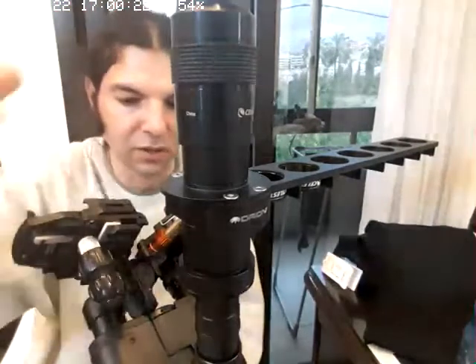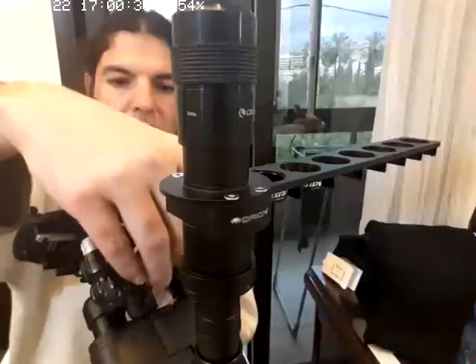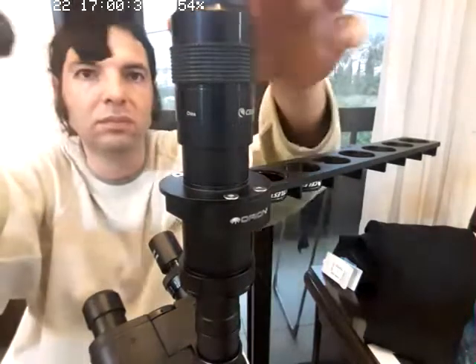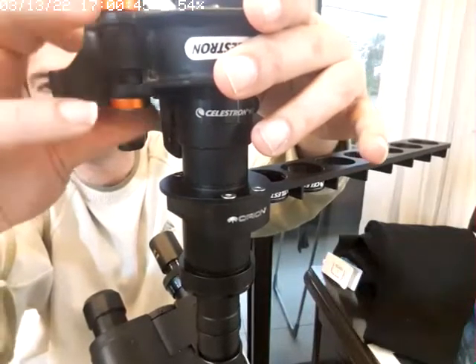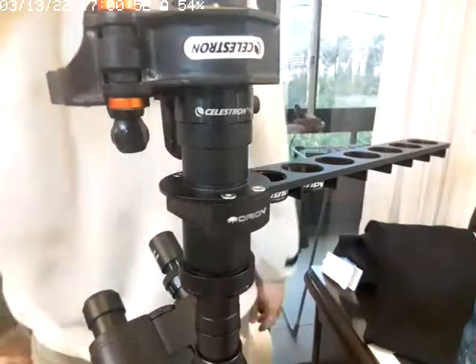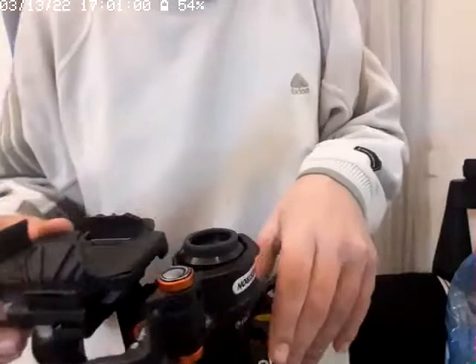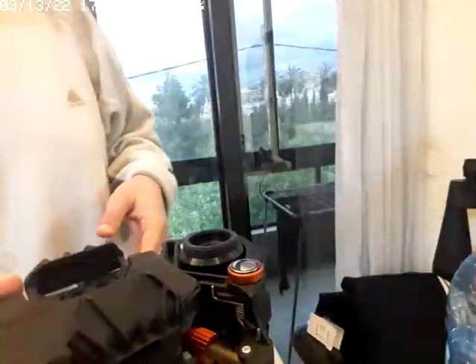As you can see, it's a very, very, very long tower. So now let's go to the front camera.